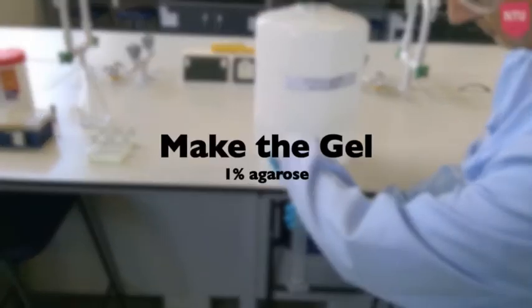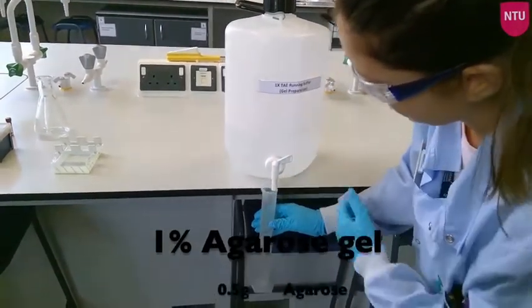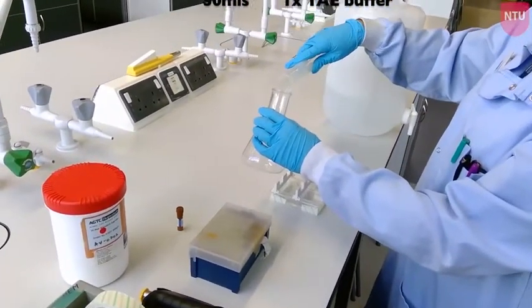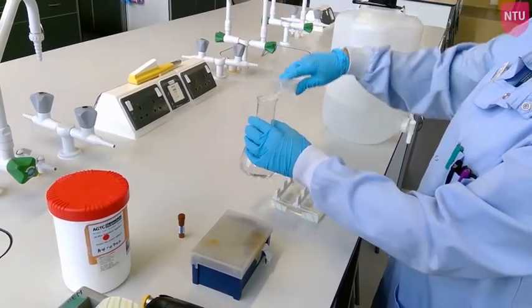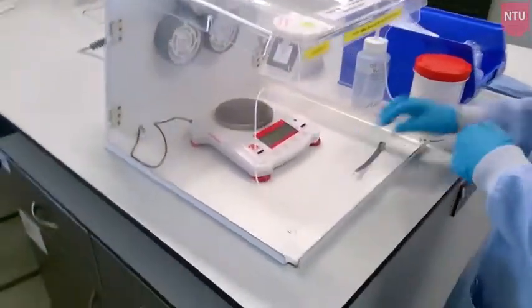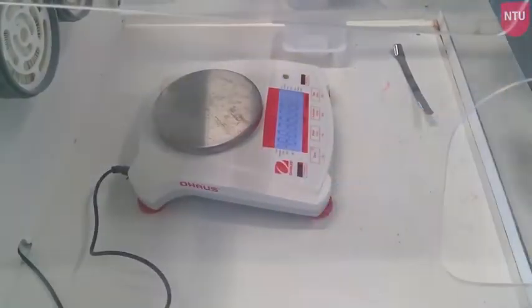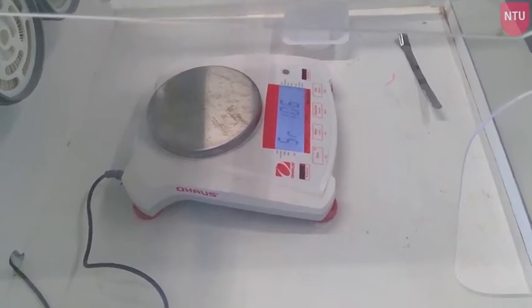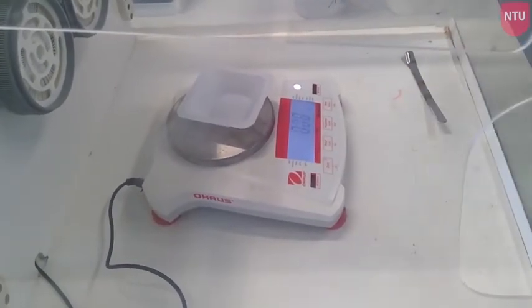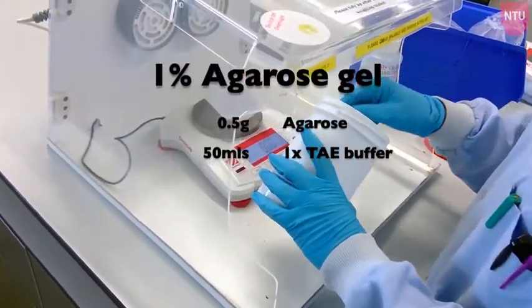Next, prepare your agarose. Measure out 50 ml of 1x TAE buffer and pour it into a 250 ml flask. Weigh out your agarose powder in the Waysafe to prevent inhalation. Turn on the Waysafe and the balance, wait for calibration, place a weigh boat and zero the balance. For a 1% agarose gel, weigh out 0.5 g of agarose to add to your 50 ml of buffer.